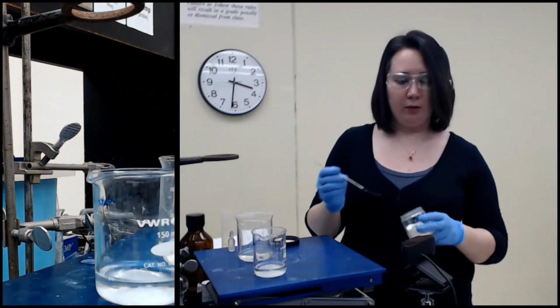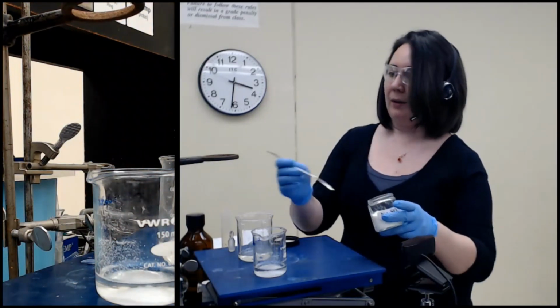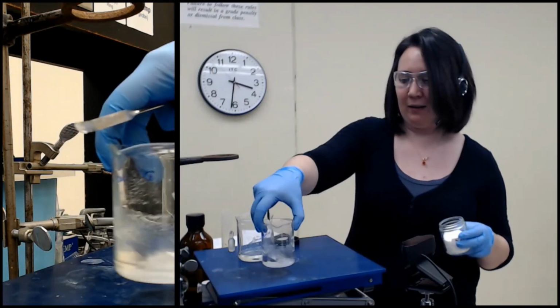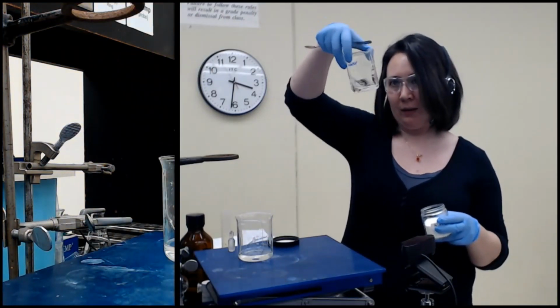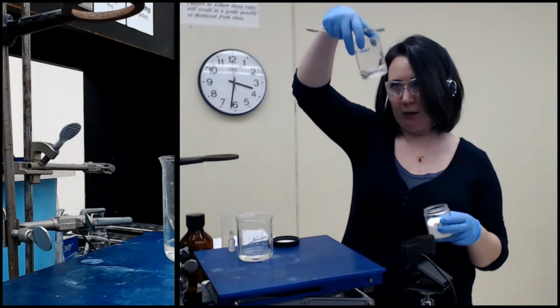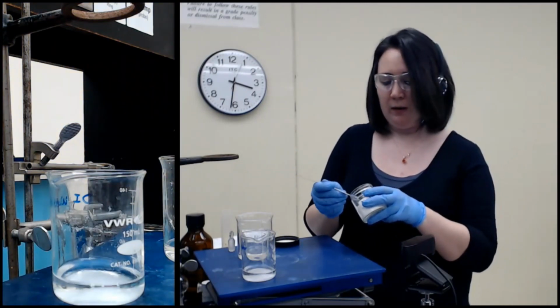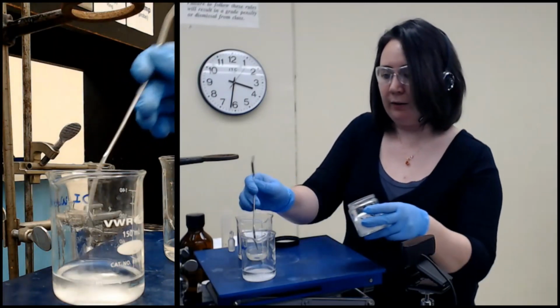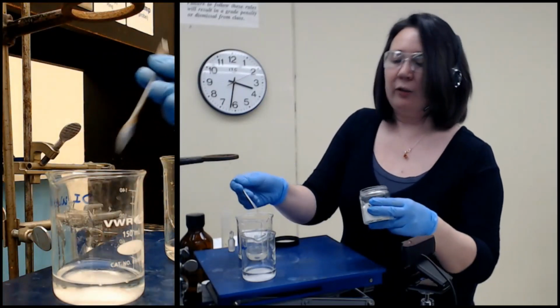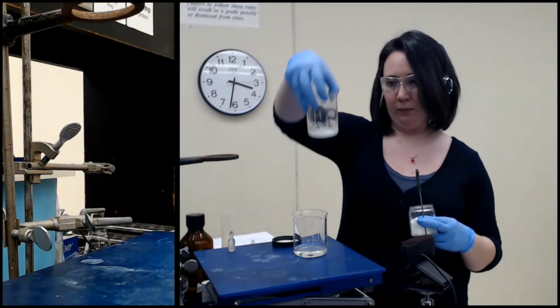You also note the liquid is quite a bit more clear now. It's not murky anymore. So I'm going to add a little bit more and swirl. And what I'm looking for is when the pieces that I add no longer try to clump up. So not quite there yet. If you had a finer powder, so this is more granular, but a fine powder, you might actually achieve that snow globe effect that people sometimes describe it as.